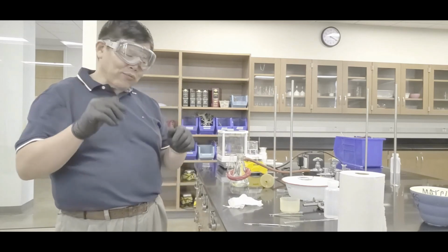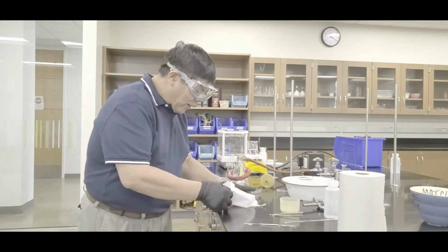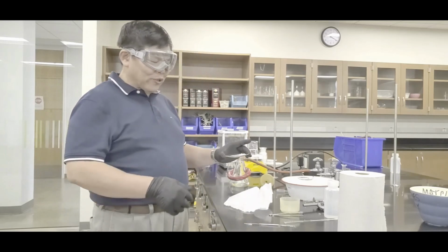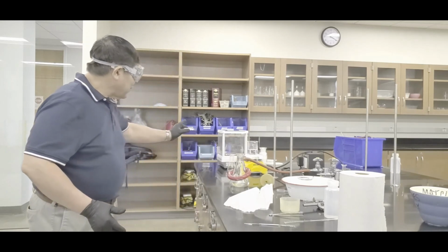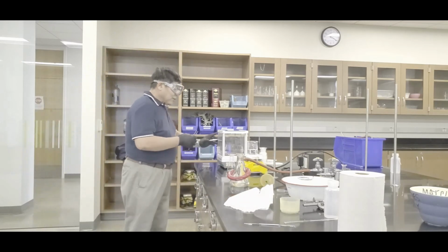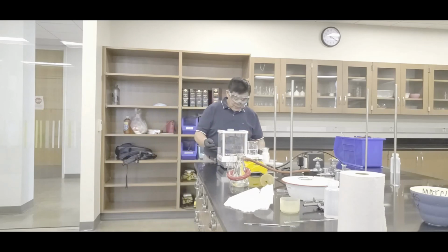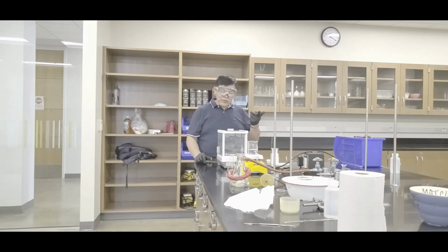Now, when it comes to the second week, when you're measuring the mass, I'm going to pretend that it's dry. We should do this, but no way. But if it is dry, you come in, zero the balance, and then do it like this, yeah? Zero the balance, and then get the tweezer and pull it across, and then weigh that, and it'll be the mass of your filter paper plus aspirin, okay? That's how you do that.